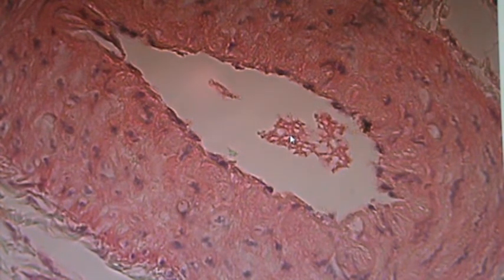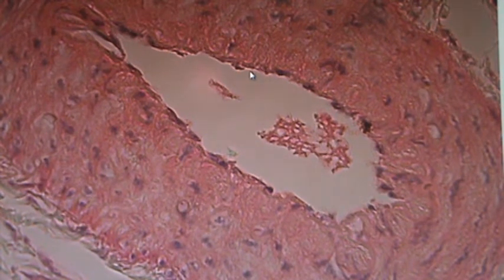Now, next, look over here on the edge. See along this very edge. So this is the lumen, and obviously this is the blood inside. This very first layer, they often call it tunica intima, and you'll learn about that later. But we call this simple squamous, because they're flat cells and they are one cell layer thick. Okay, so let's go on.